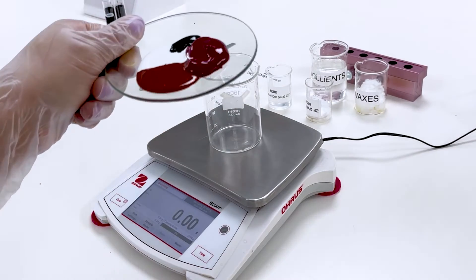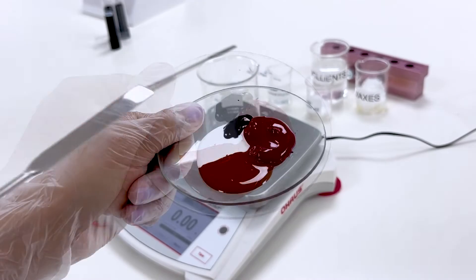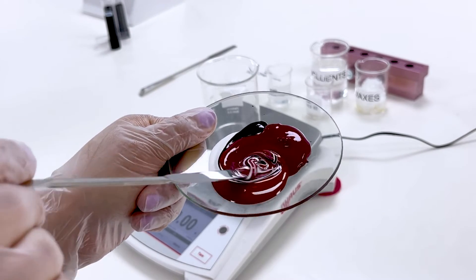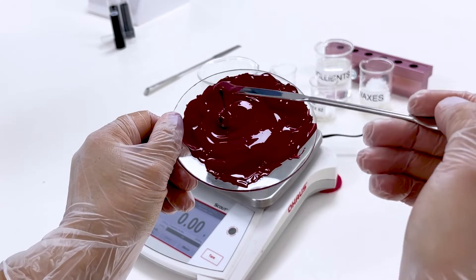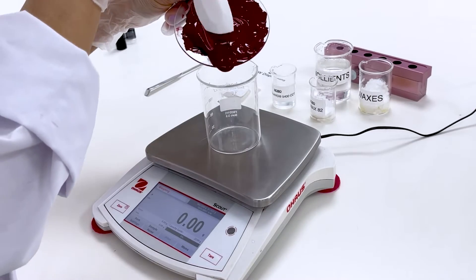We're starting off by weighing and adding in Kobo's SW dispersions. These are highly concentrated pigmentary dispersions of ITT-treated pigments dispersed in high refractive index synthetic wax, which makes them perfectly compatible with our selected emollients and waxes.